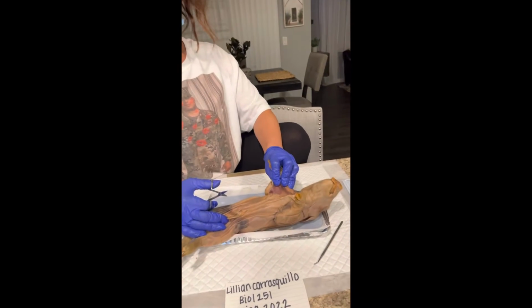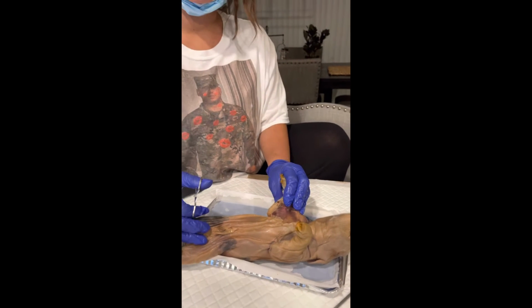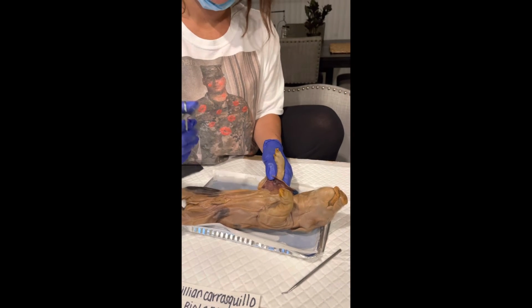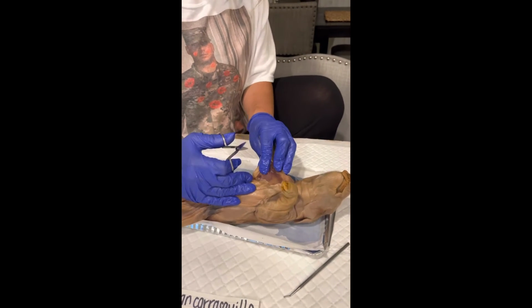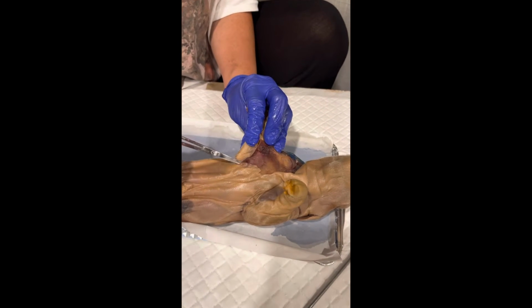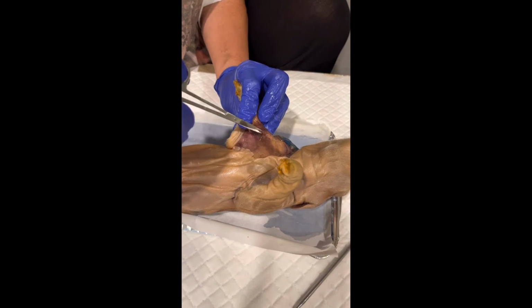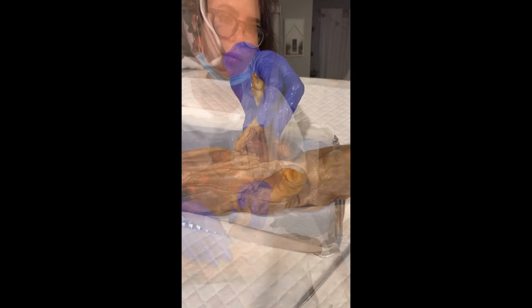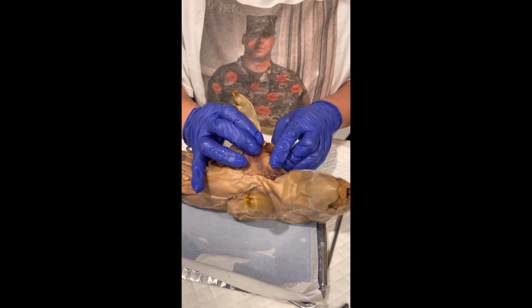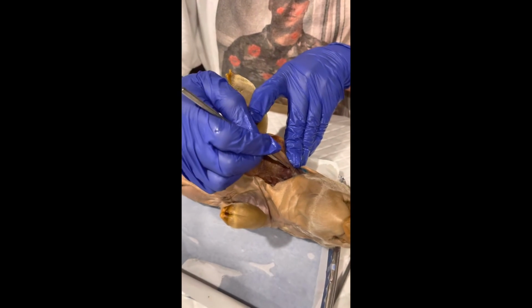Moving right along to the internal muscular system of our fetal pig, I'm going to identify all listed muscles, starting with the internal pectoralis major, which is similar to where the human anatomy of the pectoralis major is located, just right in this general area. Moving right along to the fetal pig's deltoids, that would be located right here.